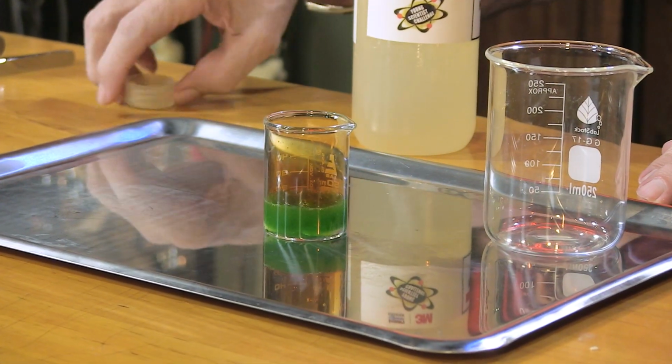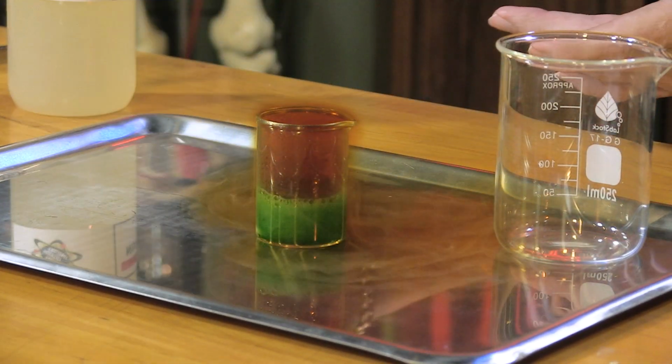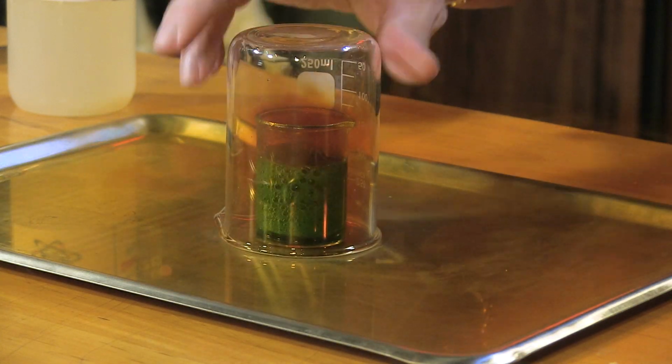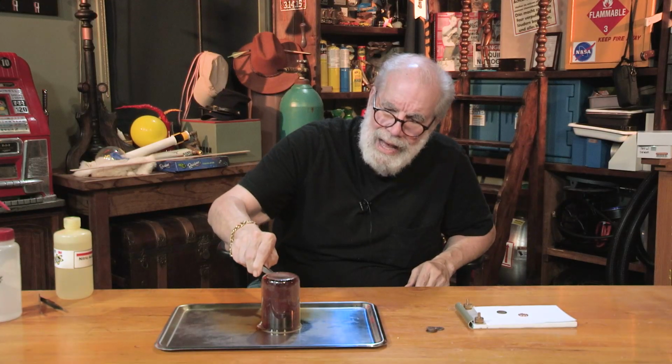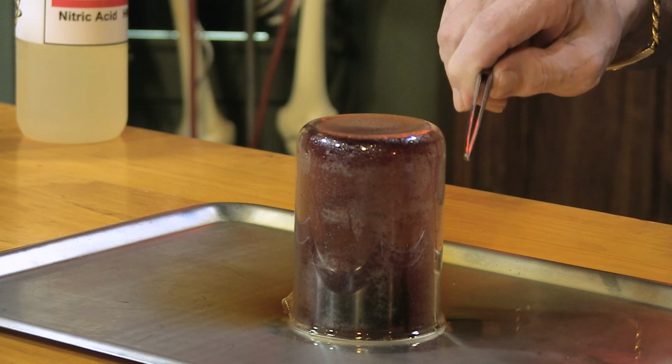Uh-oh, something's happening. And look, the liquid's turning green. Oh, oh, oh, I'm getting gas. I'm getting gas. You see that brown gas coming? I'm going to put this up on top. Hooey! So you'll see that cloud of brown gas in there. That's nitrogen dioxide. And that's deadly.